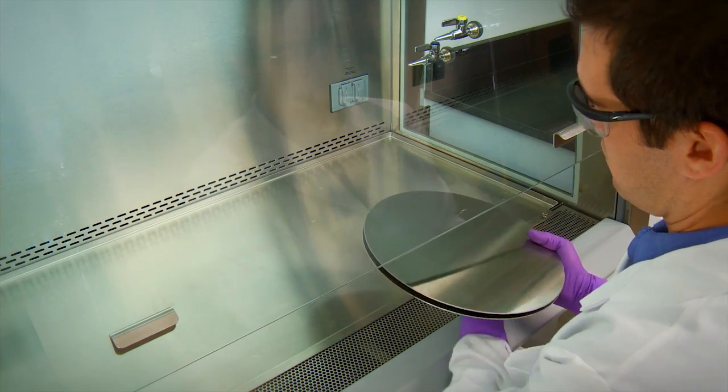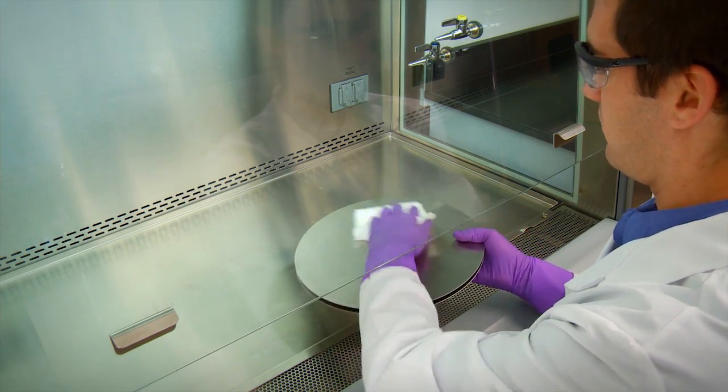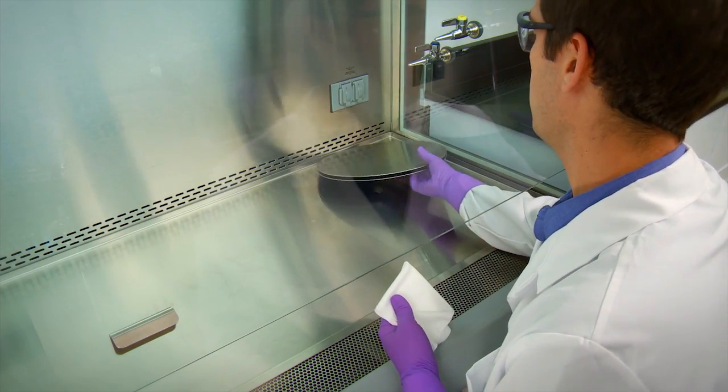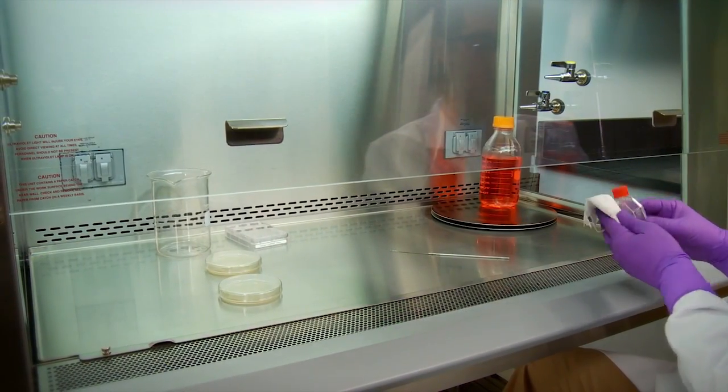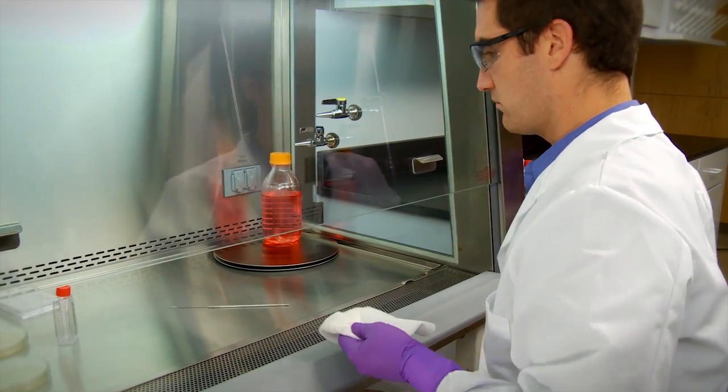This goes for your work materials as well. The surfaces of all materials and containers placed into the cabinet should be disinfected. This simple step will reduce introduction of mold spores and thereby minimize contamination of cultures.